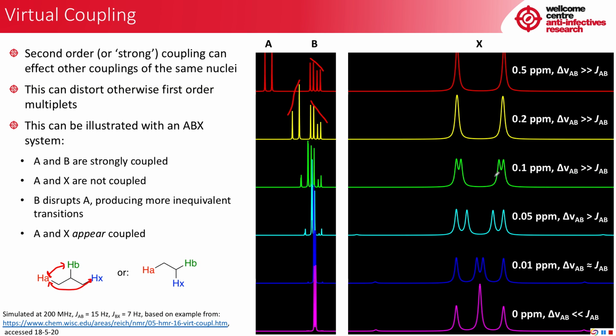However, once we get down to 0.1 ppm, this is still a much larger gap than the J value. However, we're now starting to see the appearance of another small doublet. This does not mean A and X are coupled. It means that the stronger coupling between A and B is starting to distort the BX coupling. And this is more pronounced as we get down to where the J coupling is getting closer to the chemical shift difference. Here we can see what looks like quite a pronounced set of doublets. Until finally at 0.01 ppm, the chemical shift difference and the J value are quite similar. And here we have what looks like a big doublet of doublets.